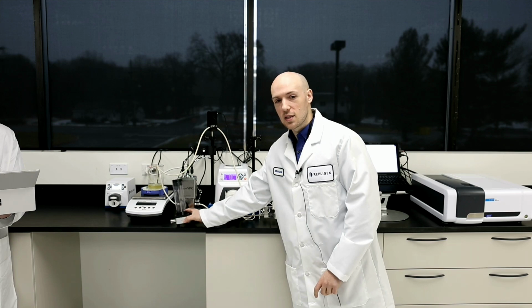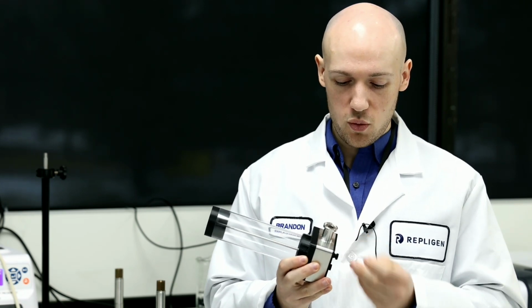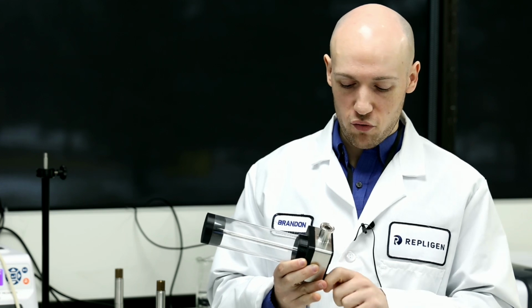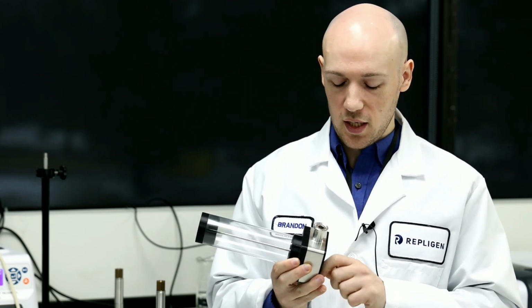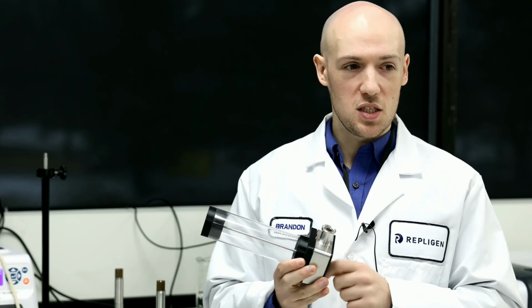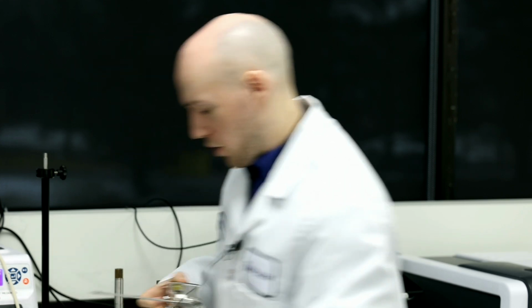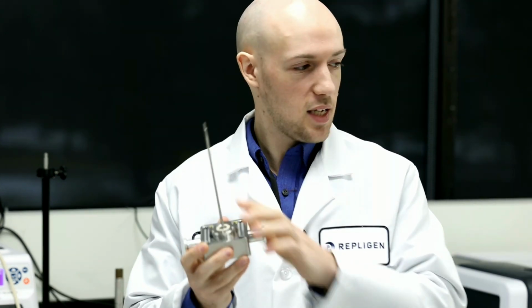Yeah. So what is nice about the FlowVPX compared to the solo VPE is it uses the stainless steel flow cell. Of course, we do have the option to use single-use flow cells, but this flow cell is reusable, it's cleanable, so you can use CIP, clean in place, or you can do SIP, which is steam in place. You can autoclave them if you want to. But basically, as you can see here, for the reusable ones, everything is stainless steel, even the fibrette itself.